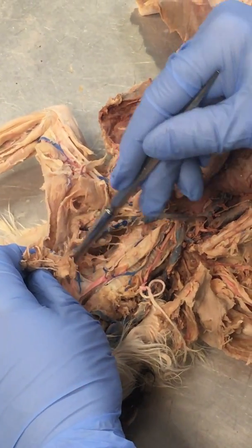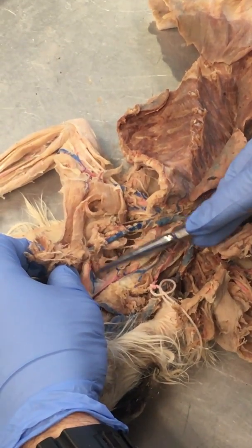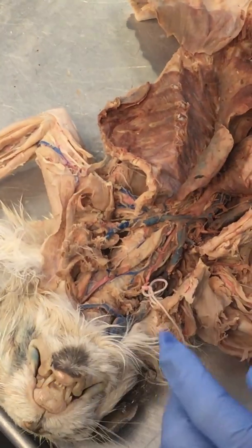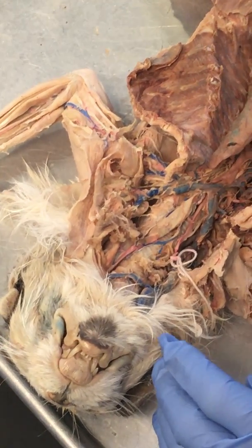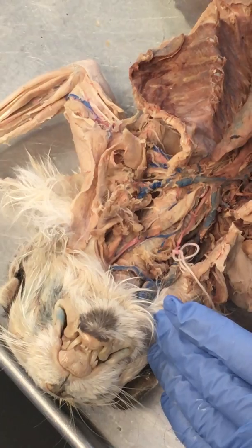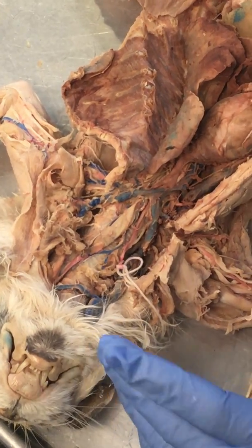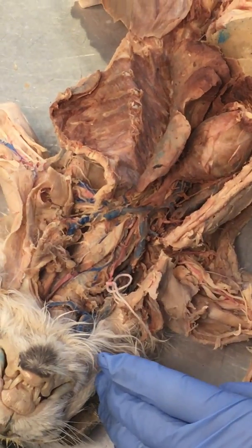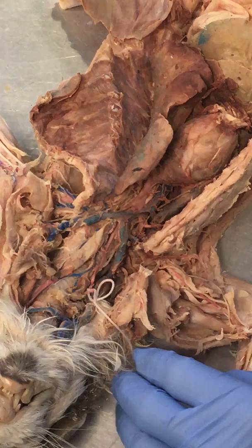That's why we call it the thyrocervical, because it comes up from the bottom, and this would actually probably be branches of the venous supply on that side. But I'm not going to ask you thyrocervical or costocervical on the cat. We might do some of them maybe from drawings like that. But I promise you we won't ask them on the cat.